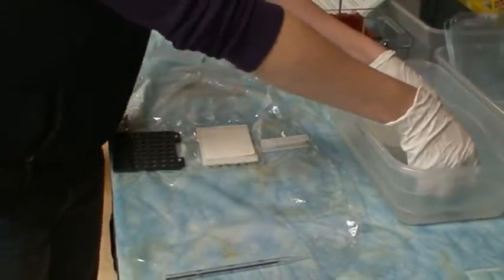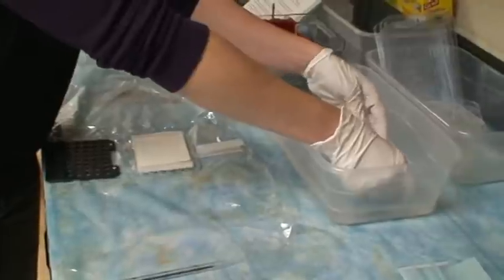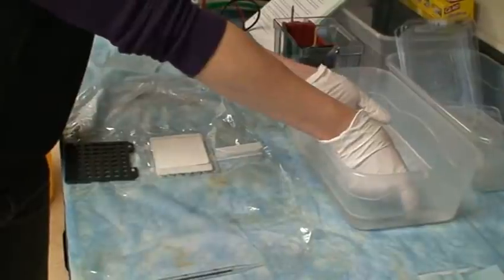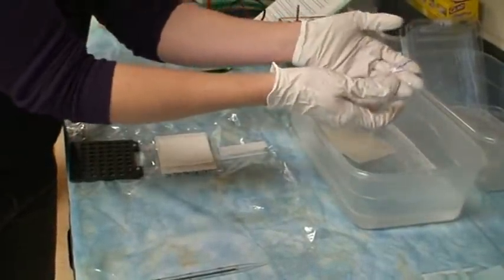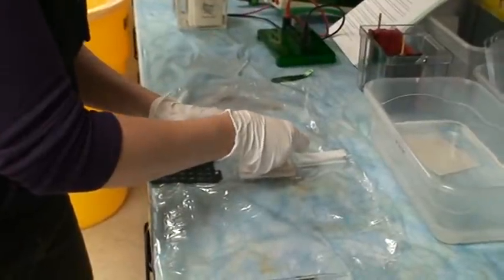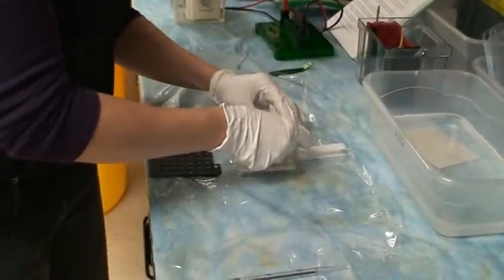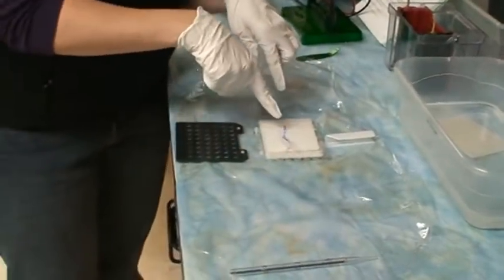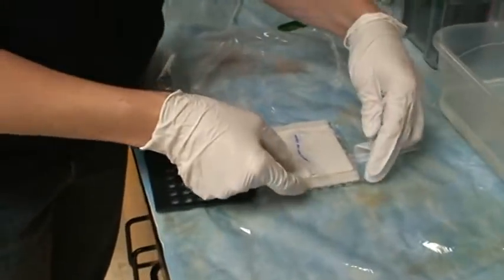Then you're ready for your gel. You'll want to be careful with your gel because it is a little bit fragile. You want to support the entire gel with your hands. Make sure that lower left notch is in the lower left corner. And as you can see here, if you were able to zoom in, I've actually torn my gel. So I hope that doesn't happen to you.